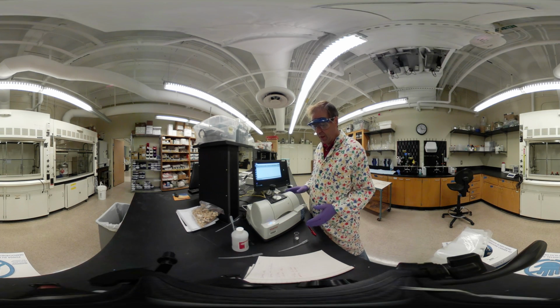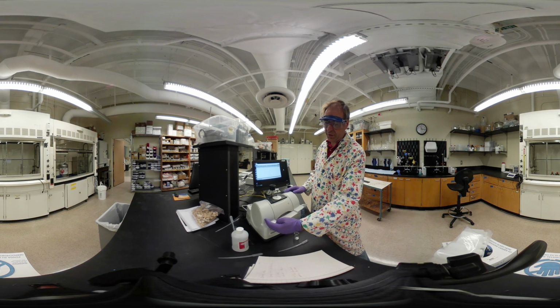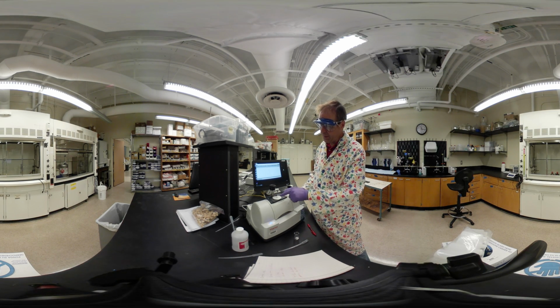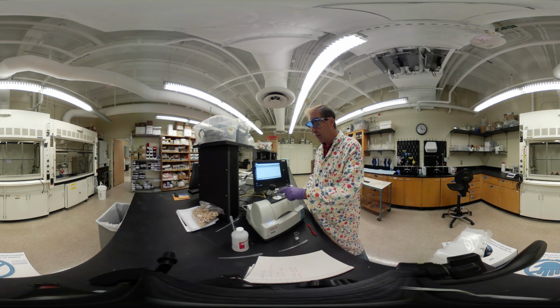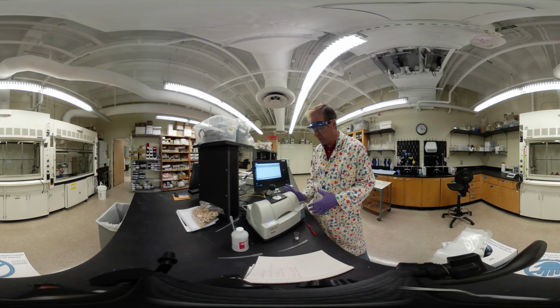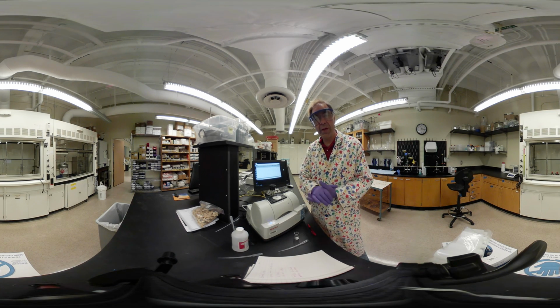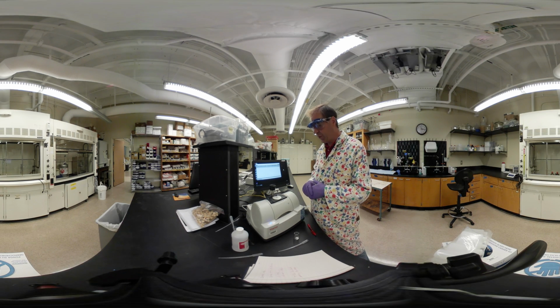So here is the infrared spectrophotometer. What you've got here is a laser that is bounced off this little window on top, and that window is actually made of diamond. Then it bounces back down and it's collected over here on this side. It can look at what vibrations in the infrared region occur. Much easier than we used to have to do these.